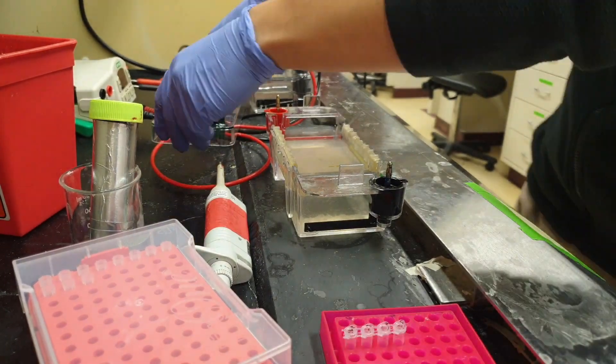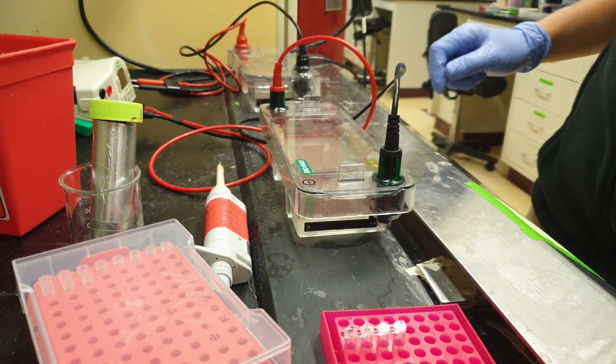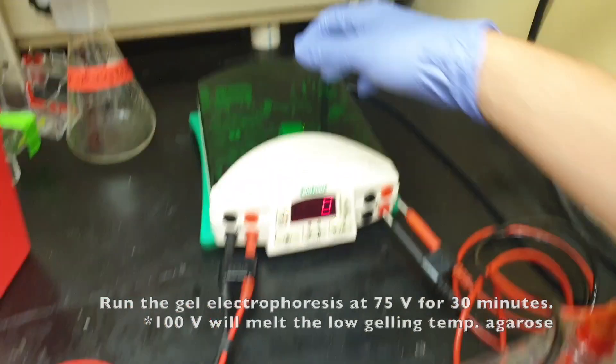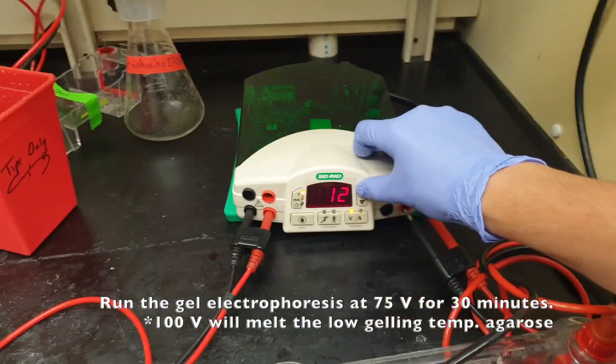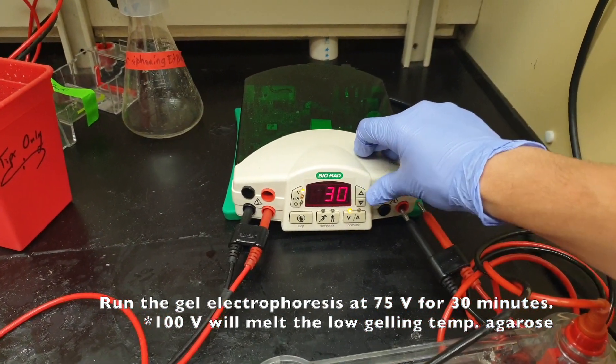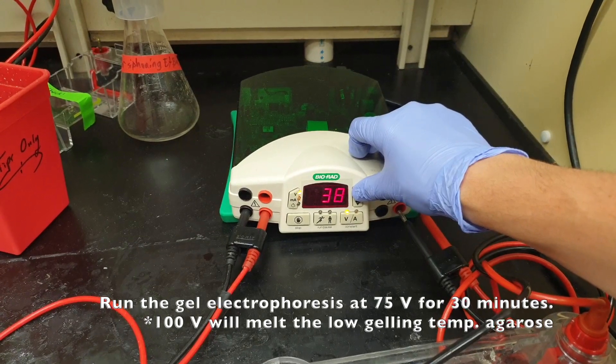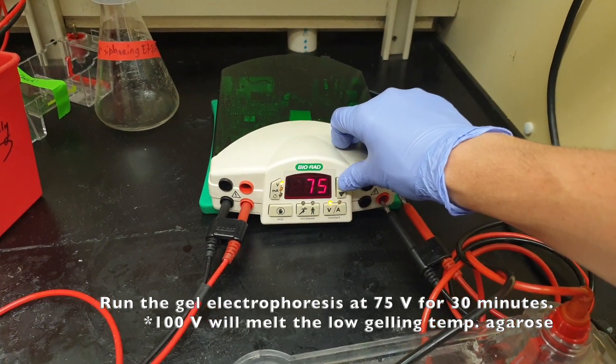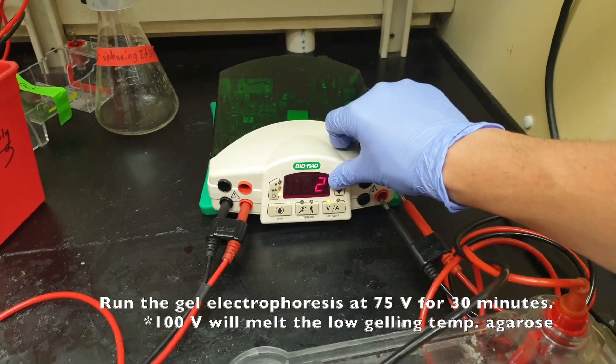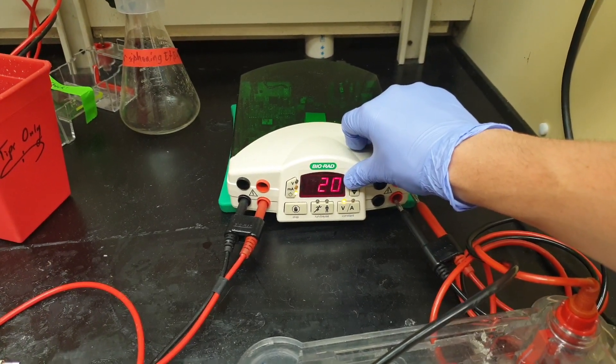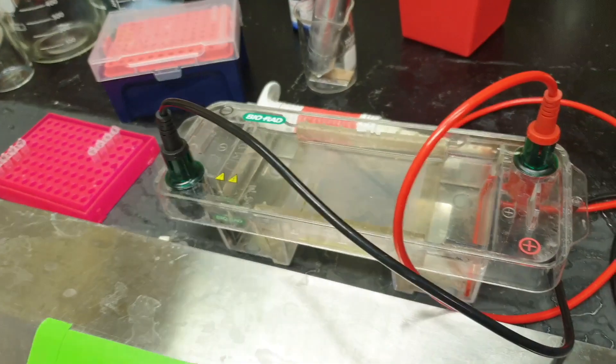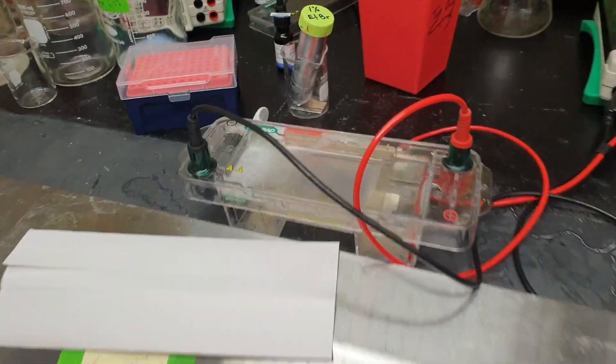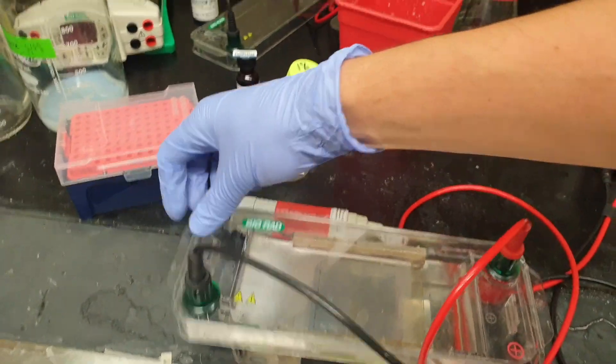Alright, next up, let's close the lid. Alright, so this is done. Let's turn off the machine. Let's take this off.